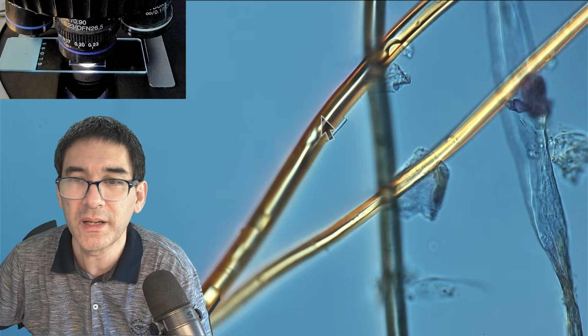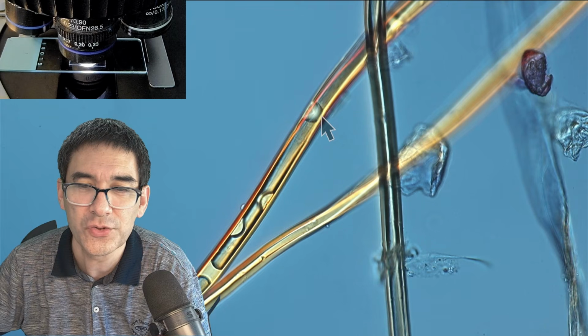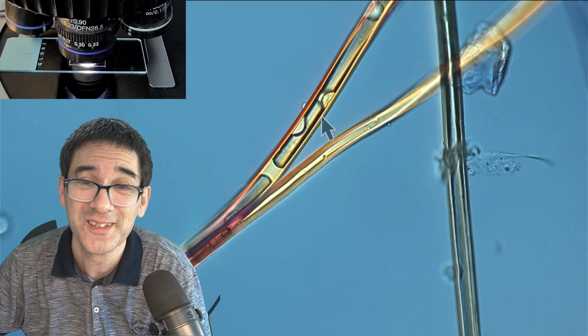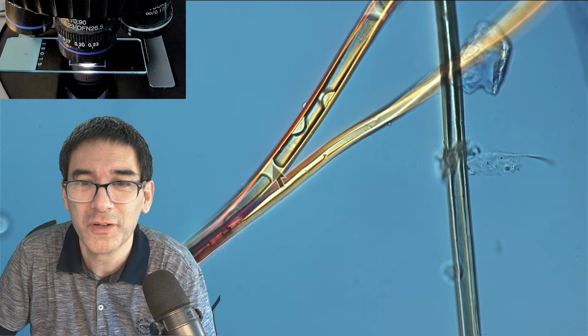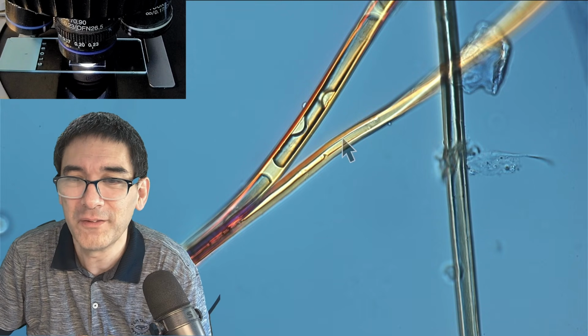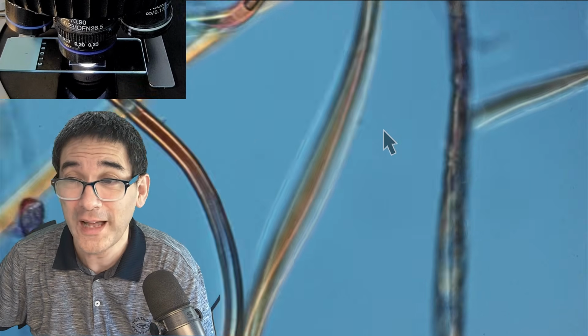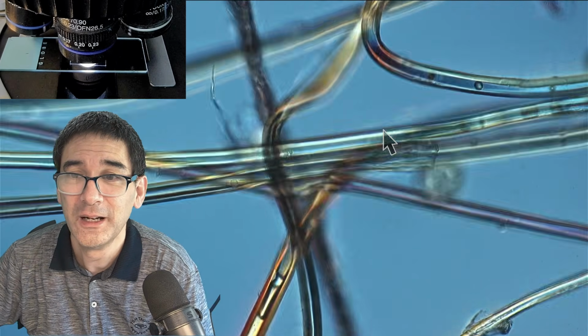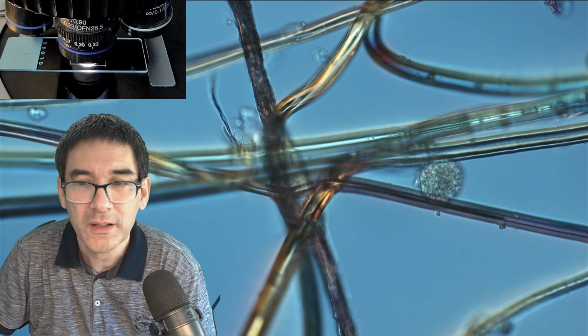I also did not expect that or know that. But that's one of the things that I like about microscopy as a hobby, that you always discover a few new things. Also over here, you see that this seems to be water, and this seems to be air again. So sometimes the water seems to have entered those tiny microscopic hairs somehow. Capillary action, most likely. I think I'm just going to remove the arrow again.